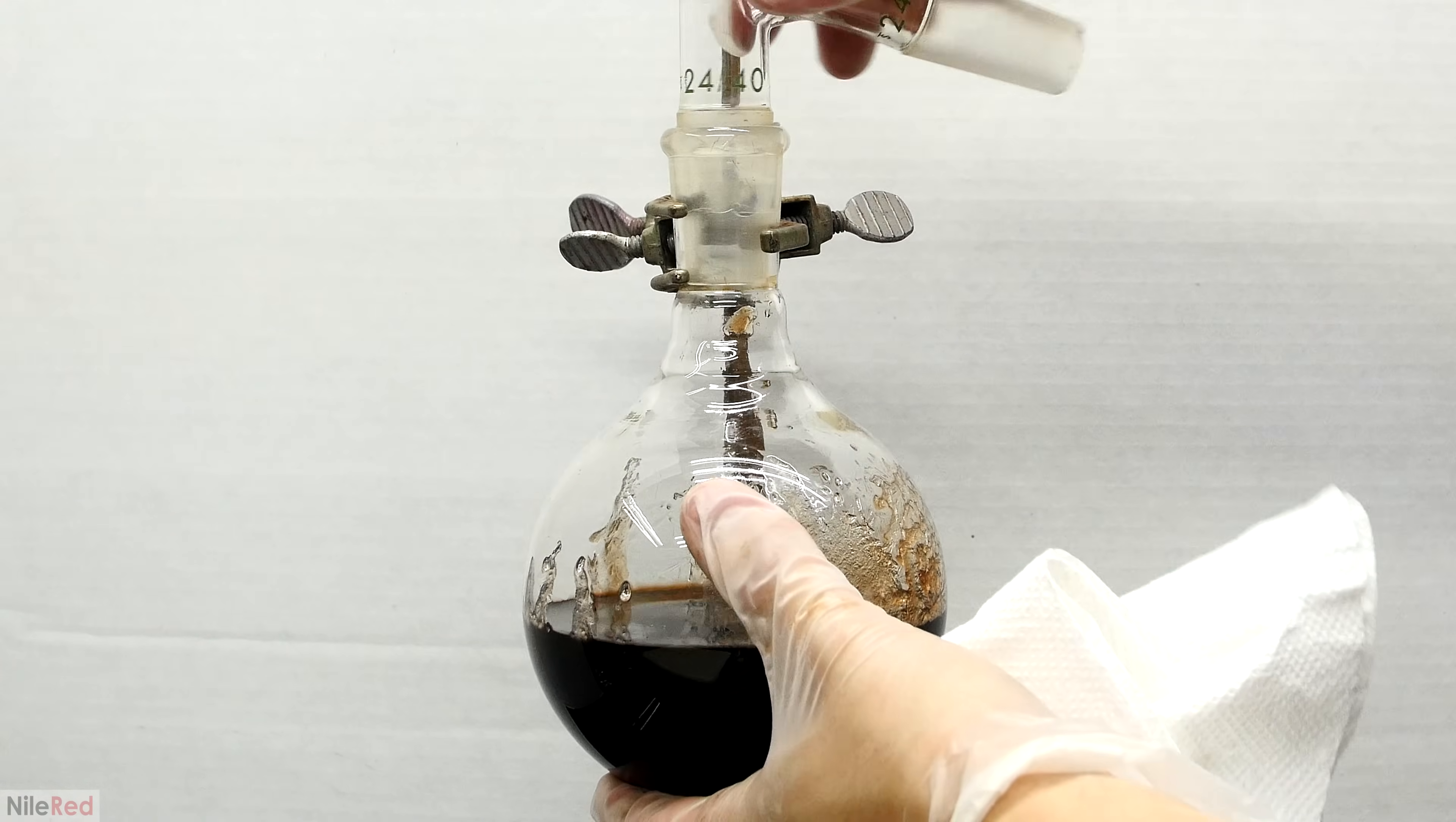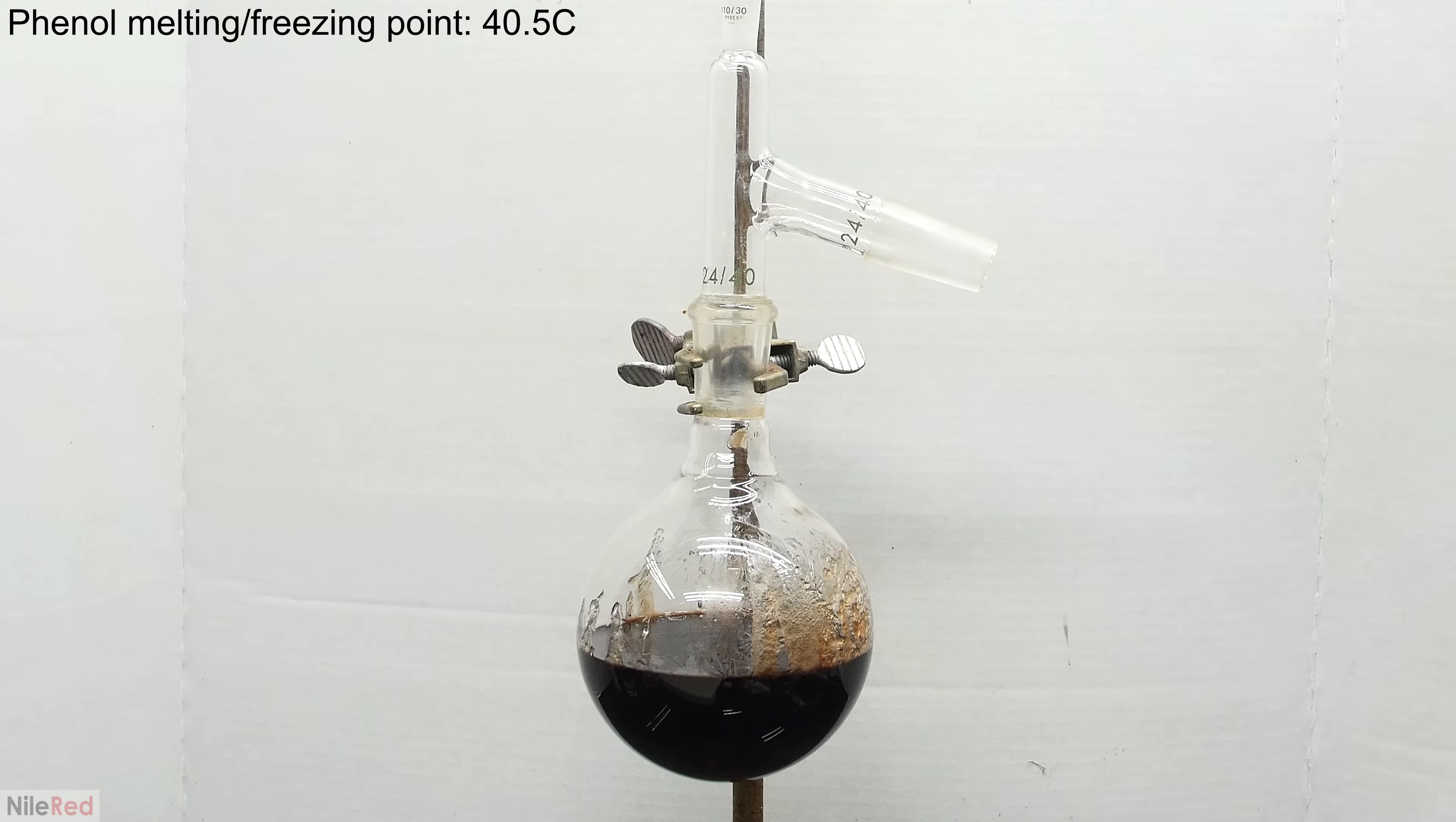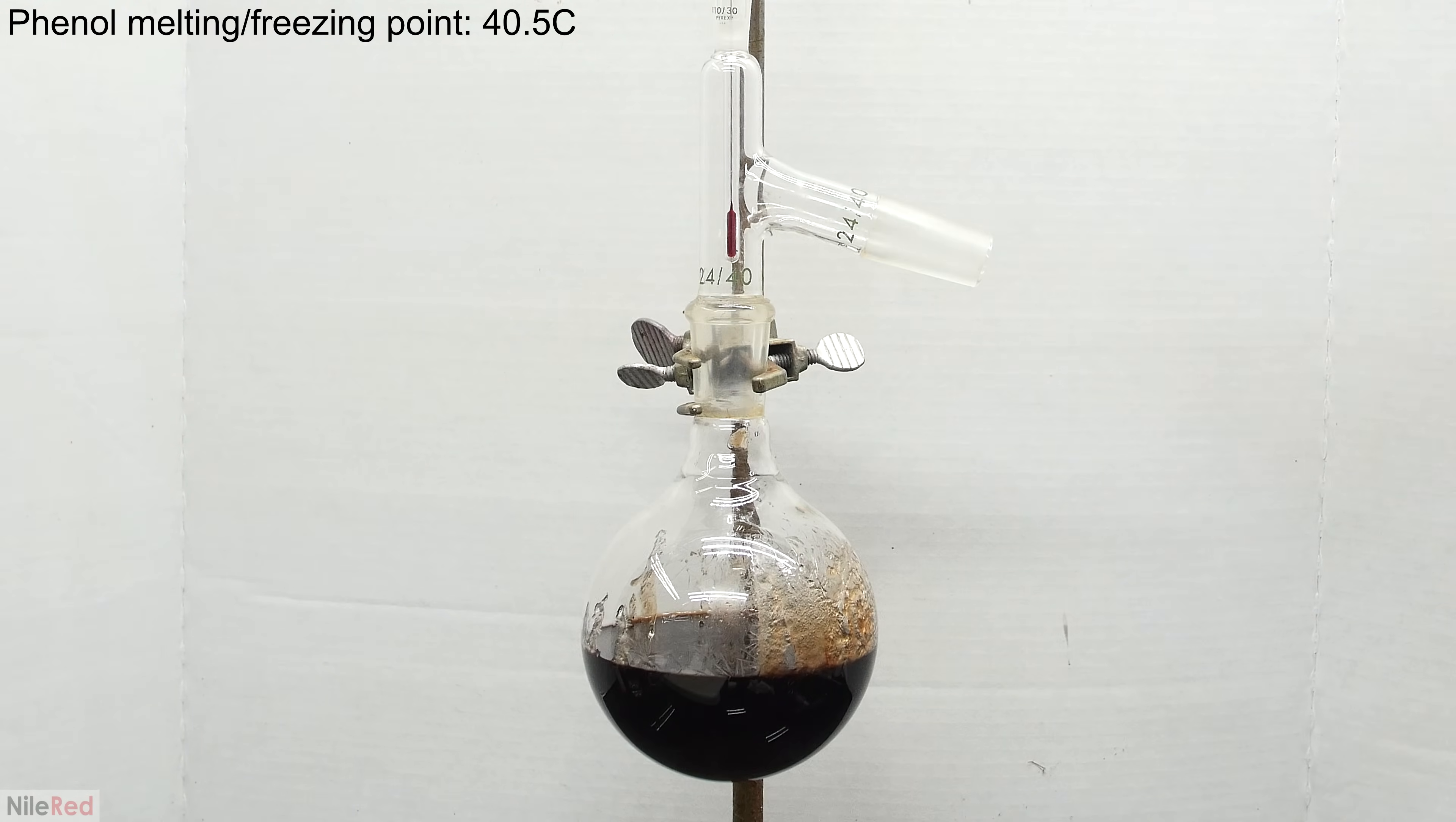I then went ahead and set things up for a short path vacuum distillation. The setup is almost the same as a simple vacuum distillation, except we don't include a condenser here. A normal cold water condenser would cause the phenol to freeze in it, so it's really not a good idea to use one.